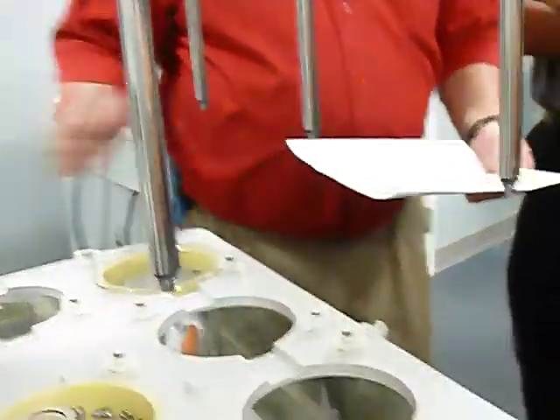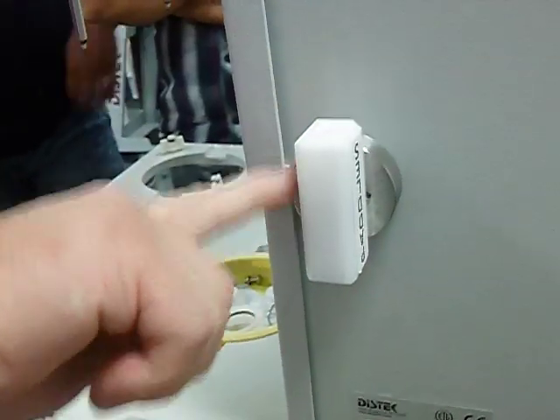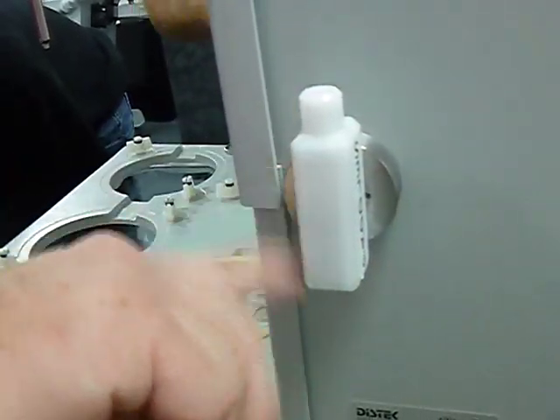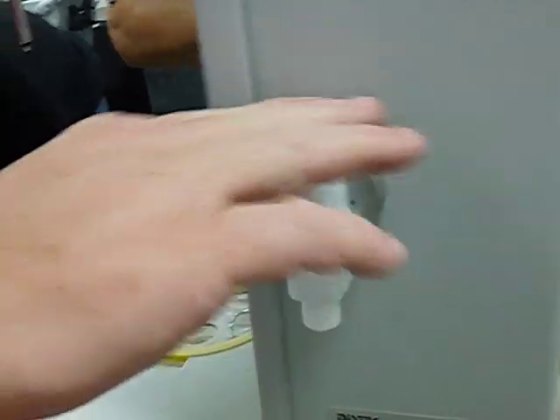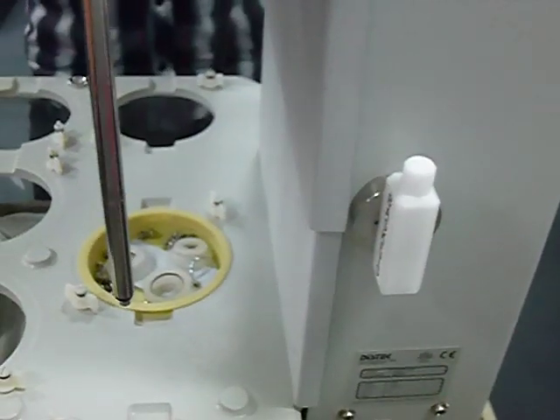All right. Again, verification of the height adjustment spacer, just to make sure that it's properly labeled. Properly labeled is the basket side is for where the hole is up on top of here. It usually has this attached. Baskets on one side, and it should have paddles on the other side. Flat on here. This one has the raise. That's for the baskets. That way, when we go through the adjustment process, the way you adjust this works fine.